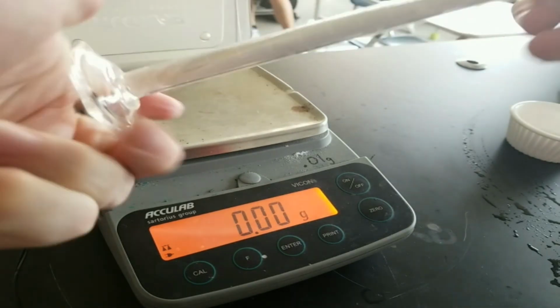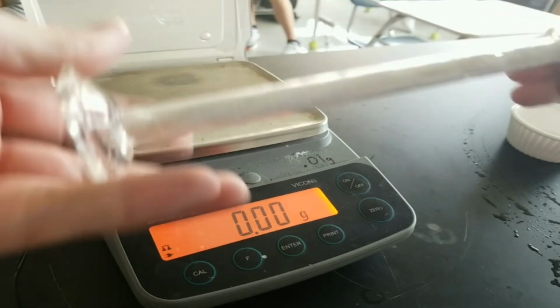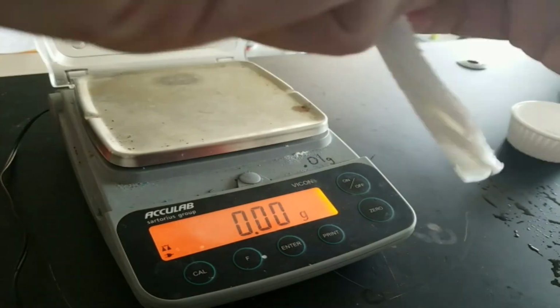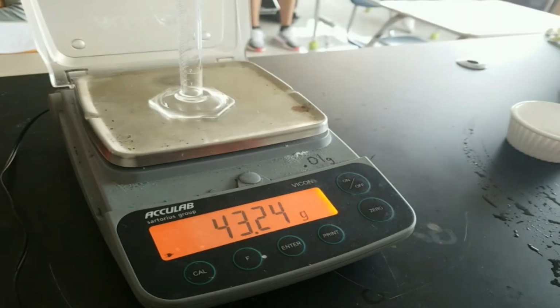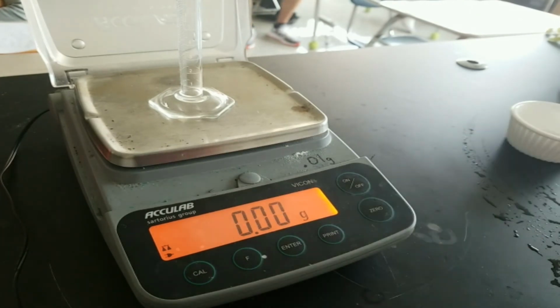And so then sit there and just rotate it a bit. You have to scrub the insides of that cylinder and then wipe down the outside so it's not slippery. Now you want to be careful with the cylinders because they can fall and break. We want to reduce that. So I'm reducing error. Now I put it on the balance and I zero it because I want the balance to ignore the weight of the cylinder.